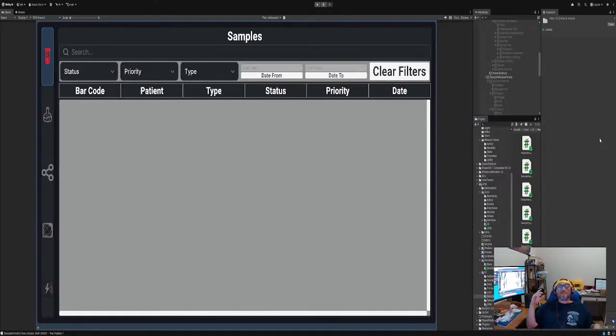Okay, now we have an issue, right? Do you want it to be automatically editable data once the window's open? I could see people making mistakes, or we could just show it static and then press edit and it goes there. I think that's what we're gonna go with.